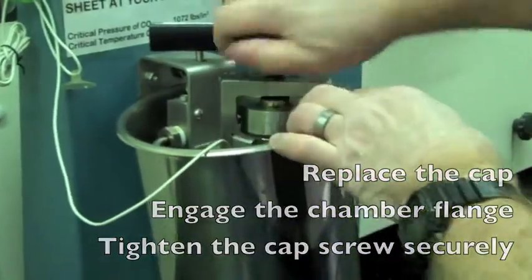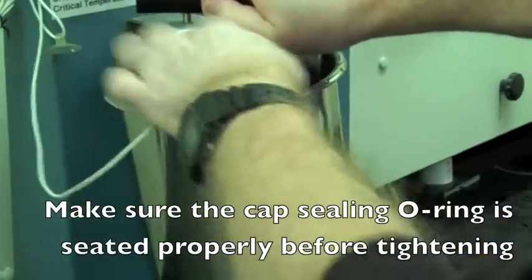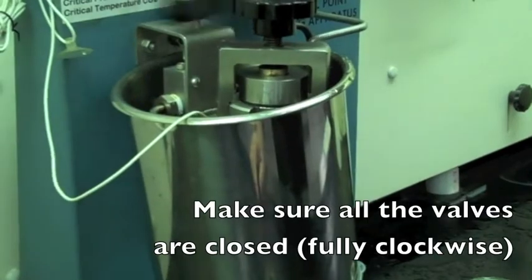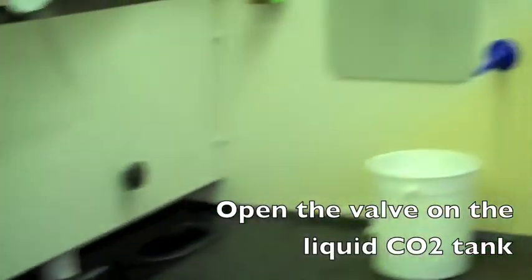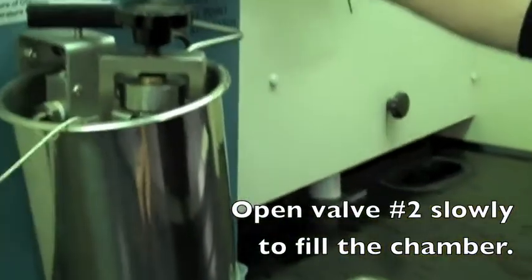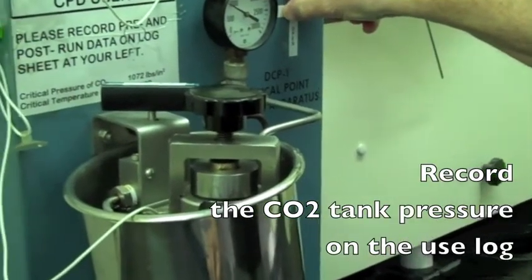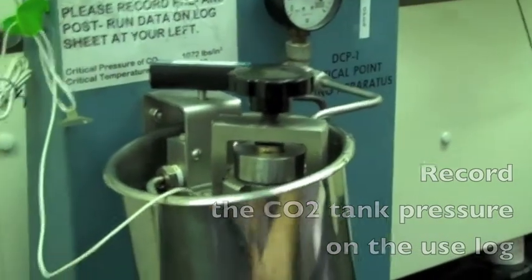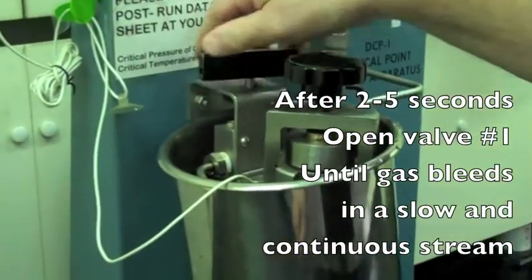Twist and tighten. All the valve shut. Open this, fill the chamber.